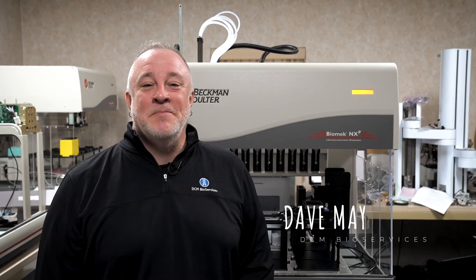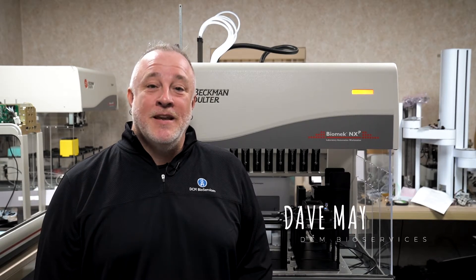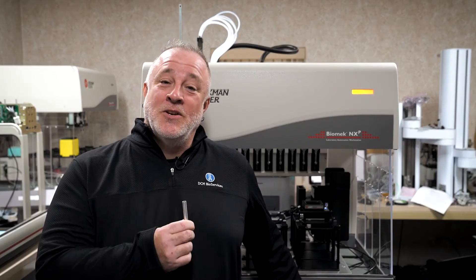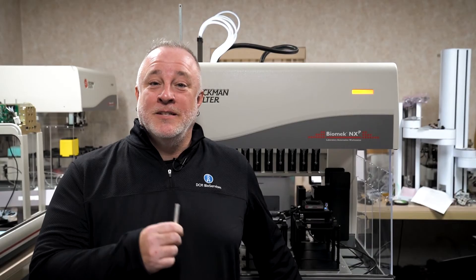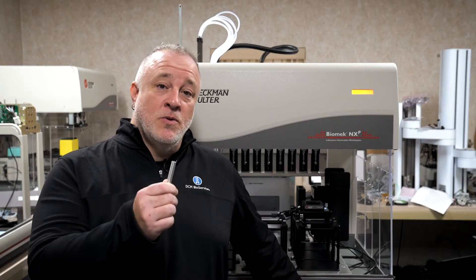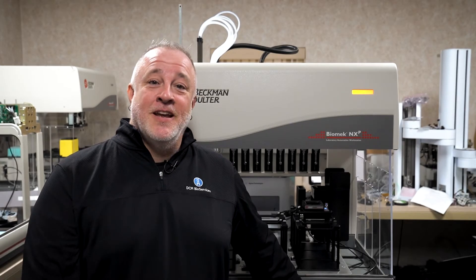Hey everyone, this is Dave from DCMBio. Today I'm going to go over teaching the deck using a Span 8 on the FXP NXP platform. Check out our other video for using the teaching tool to teach the deck on versions 4.1 or below. For version 4.2 or higher, you no longer have to use the teach tool. Let me show you how this is done on the deck.